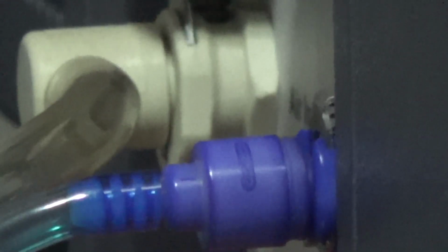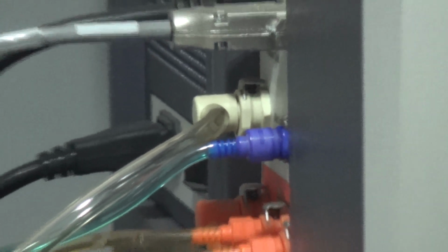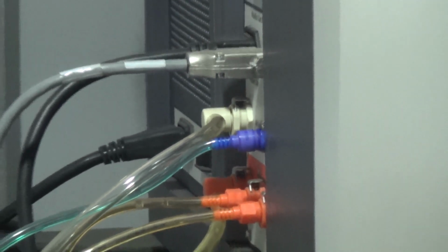Next, as this is a flow cytometer, there is a constant pressure in the machine. We maintain the pressure through this tube by giving air pressure. Here you can also see it labeled as air in. Through this white tubing, air will go inside. That will maintain the pressure while we run the sample and while we count the sample.